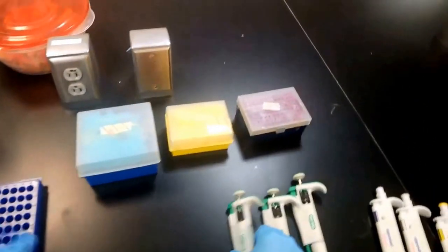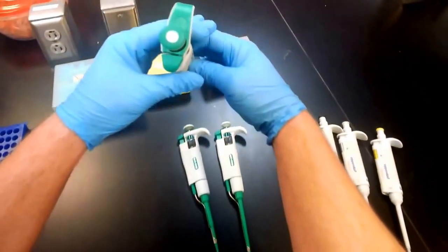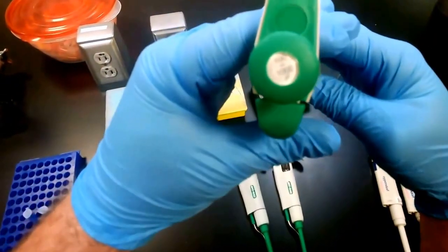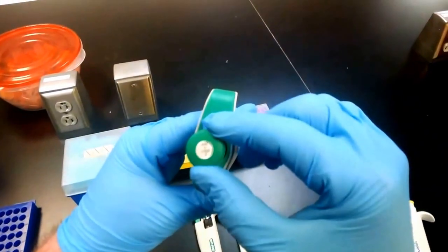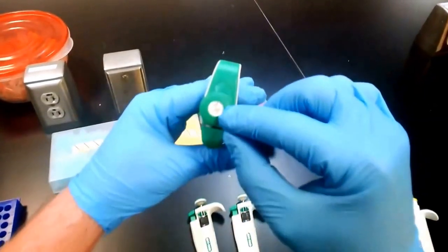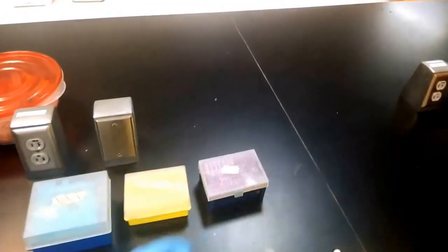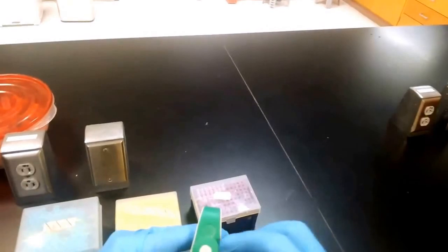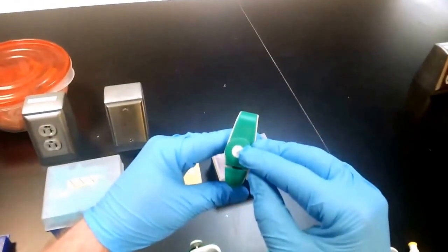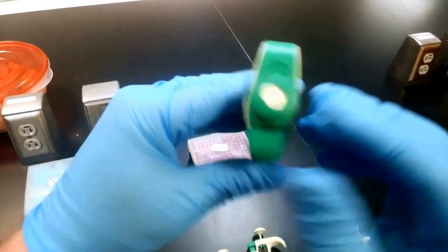So let's look at our Bio-Rad micropipettes. We'll start with the largest size, which says 100 to 1000 microliters. Of course, 1000 microliters is one milliliter. And we have, going down an order of magnitude, 20 to 200, and finally another order of magnitude, 2 to 20.